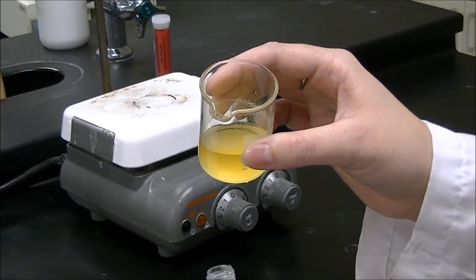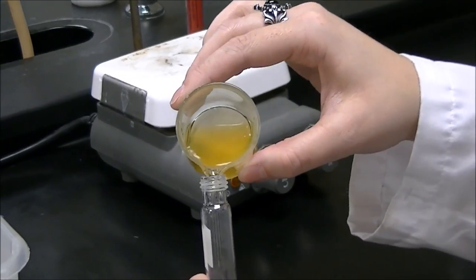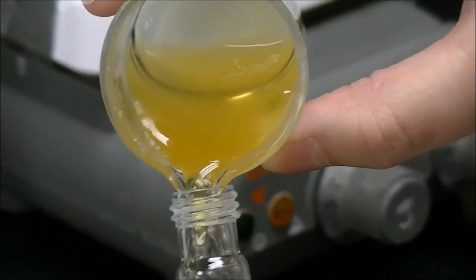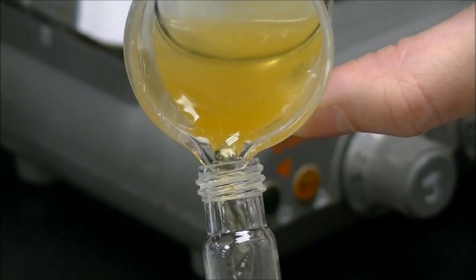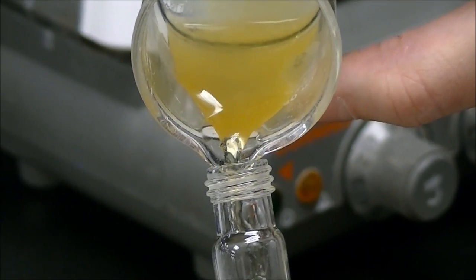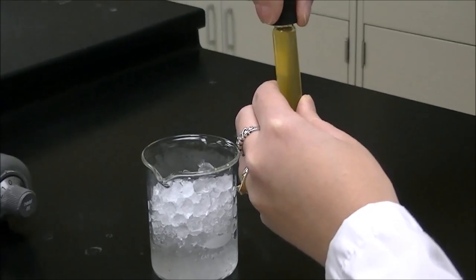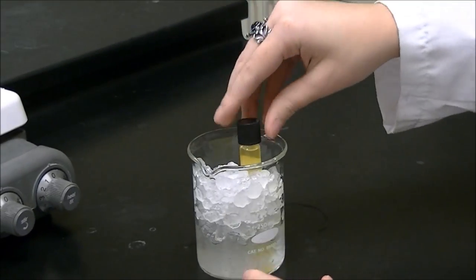Once you've allowed the solution to cool and the solid has settled to the bottom, decant just the liquid out. It goes into a centrifuge tube and into an ice bath for three minutes.